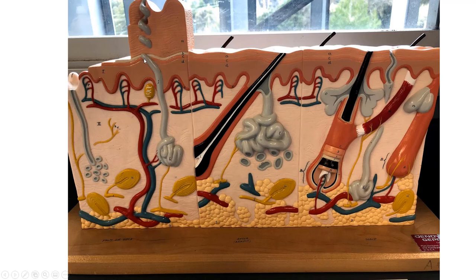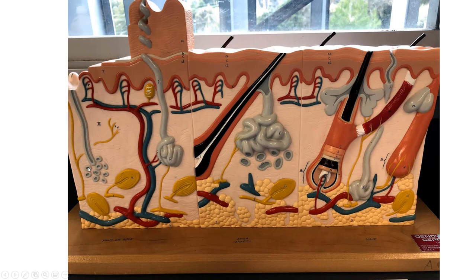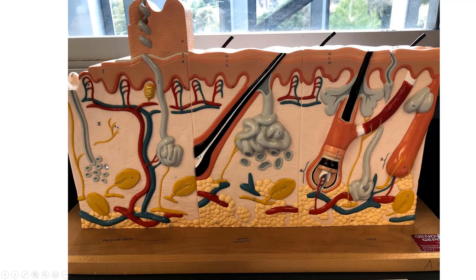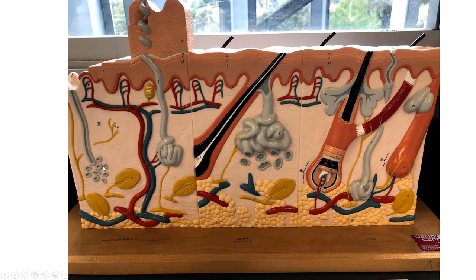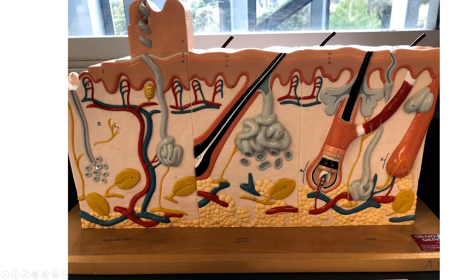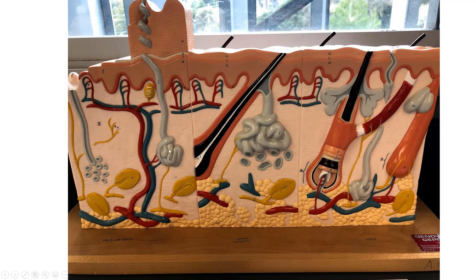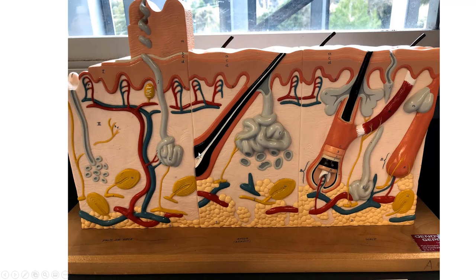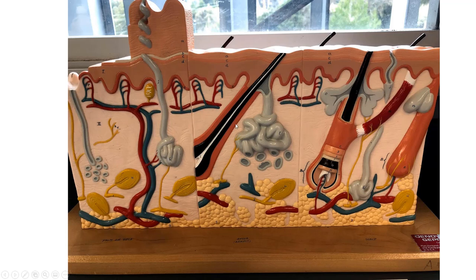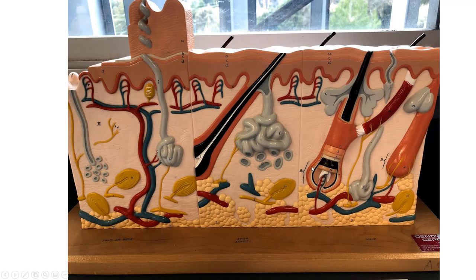The big sweat glands that empty into hair follicles are apocrine. The other ones that are smaller and go to the surface are merocrine, also called eccrine. Notice when you take a cross-section or cut through it, it looks like a bunch of little tubes or circles — that's what it's going to look like on the microscope.